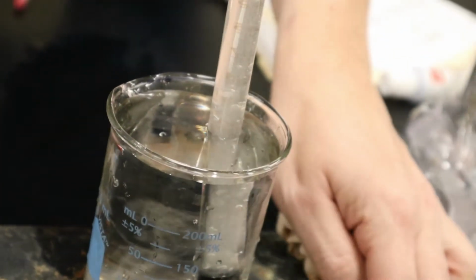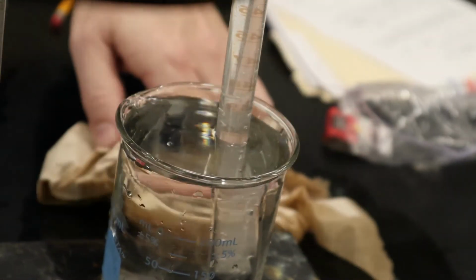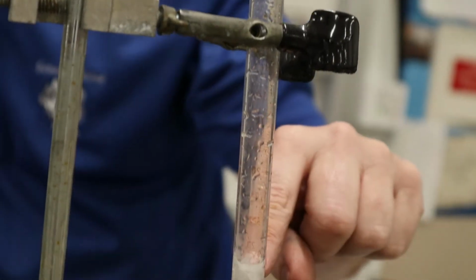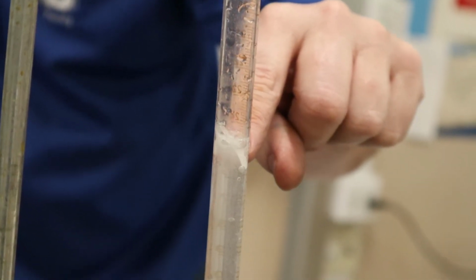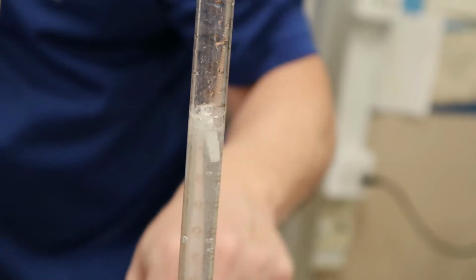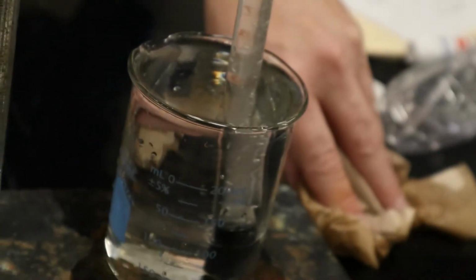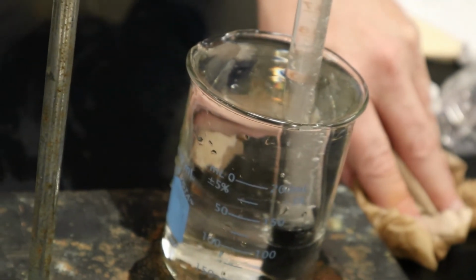But it's just water because the acid is being reacted, so I'm good. All right, and you can see, oh, the magnesium broke off the tape, but it's still reacting, so that's good. It shouldn't be any problem. Actually, I hope it doesn't go below the 50 line or we're in trouble. Then I have to do it all over again. All right. I think I used too big of a piece.